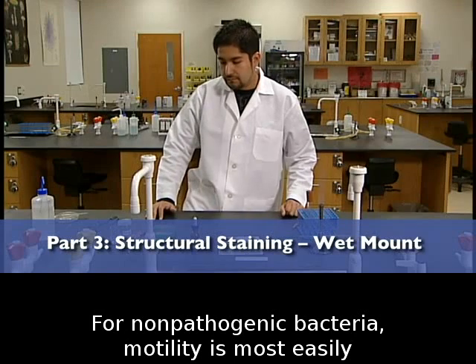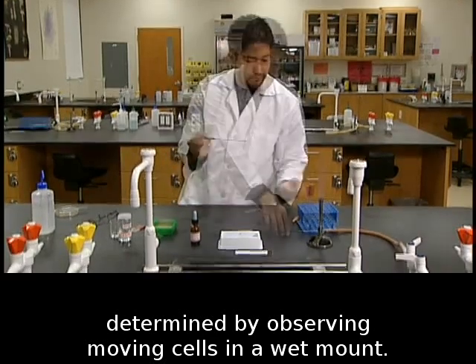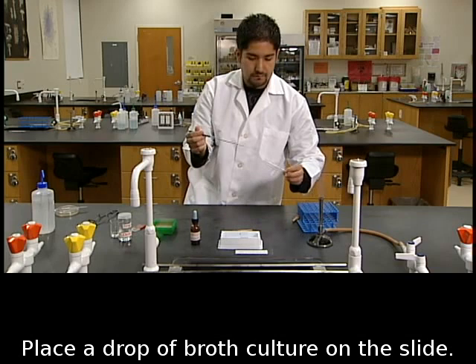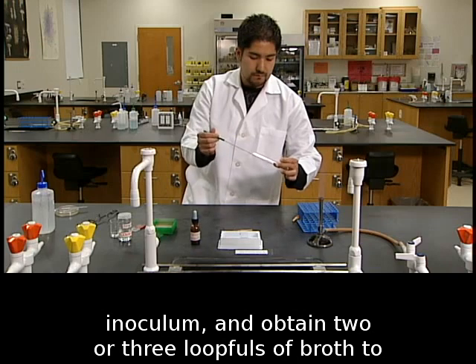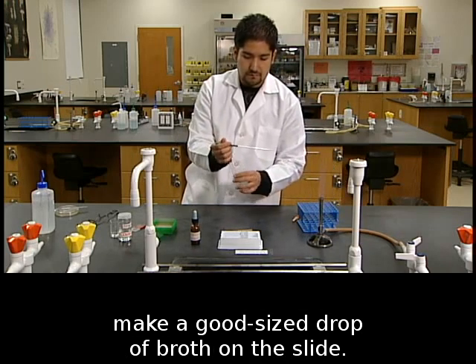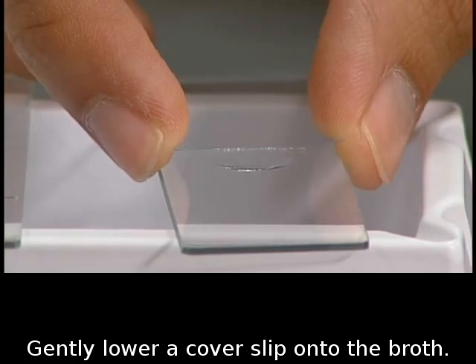For non-pathogenic bacteria, motility is most easily determined by observing moving cells in a wet mount. Place a drop of broth culture on the slide. Flame the loop, flame the mouth of the tube of inoculum, and obtain 2 or 3 loopfuls of broth to make a good-sized drop of broth on the slide. Gently lower a cover slip onto the broth.